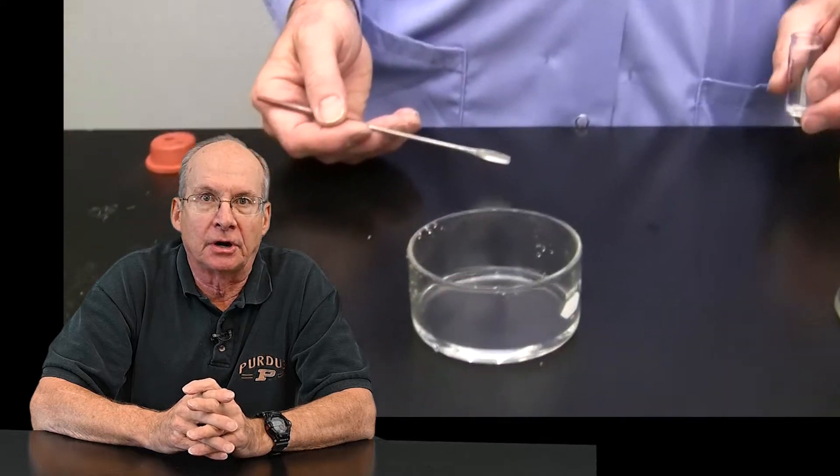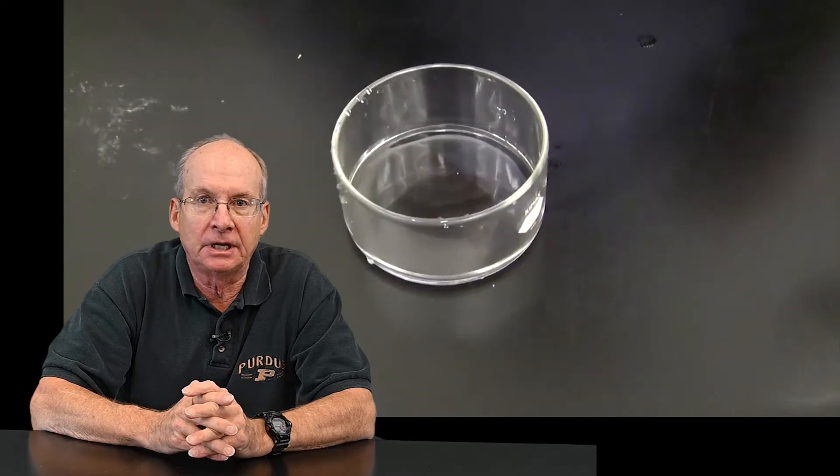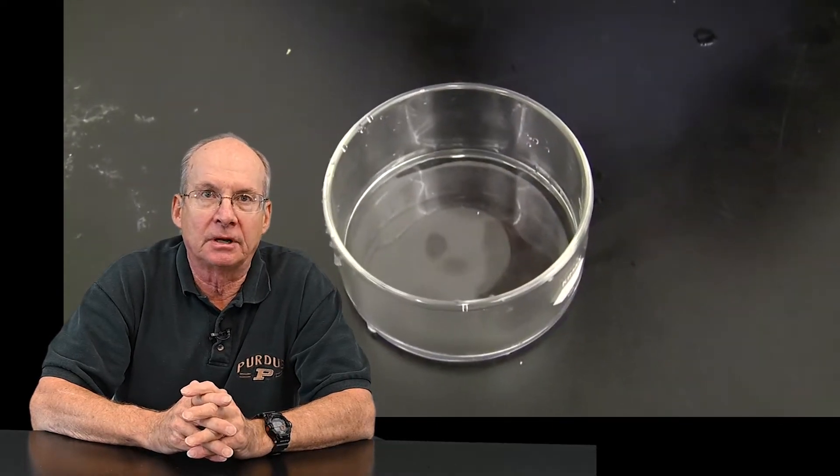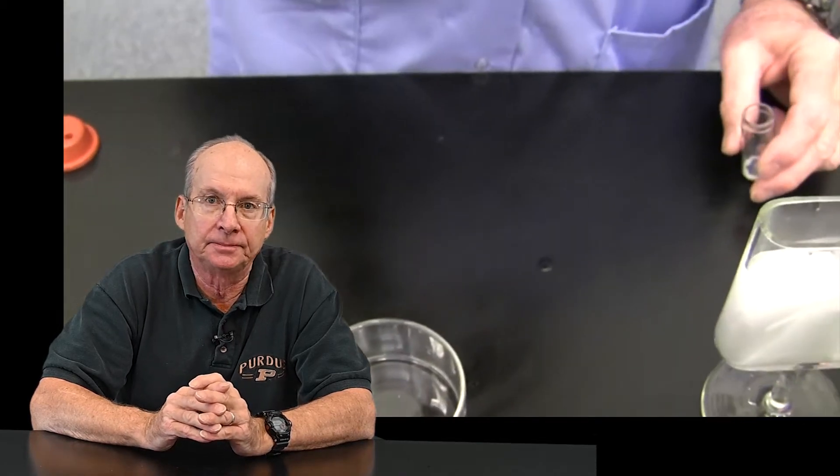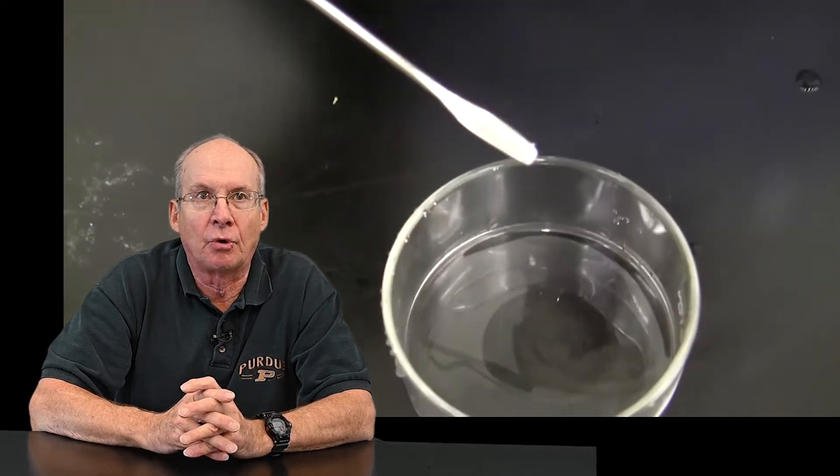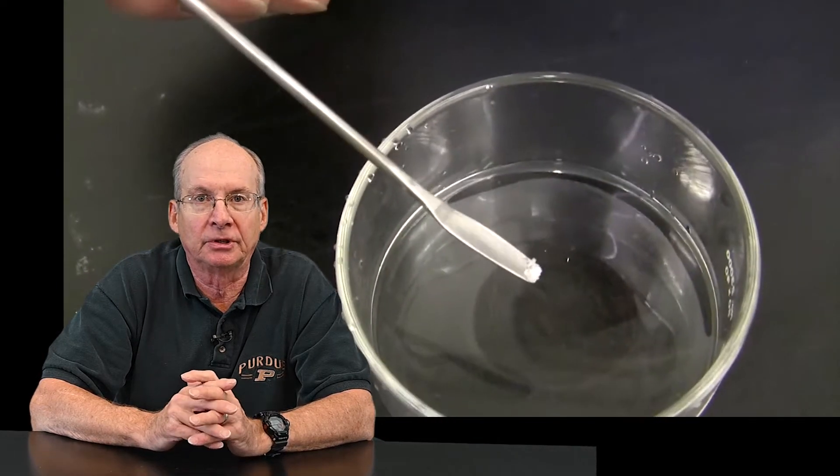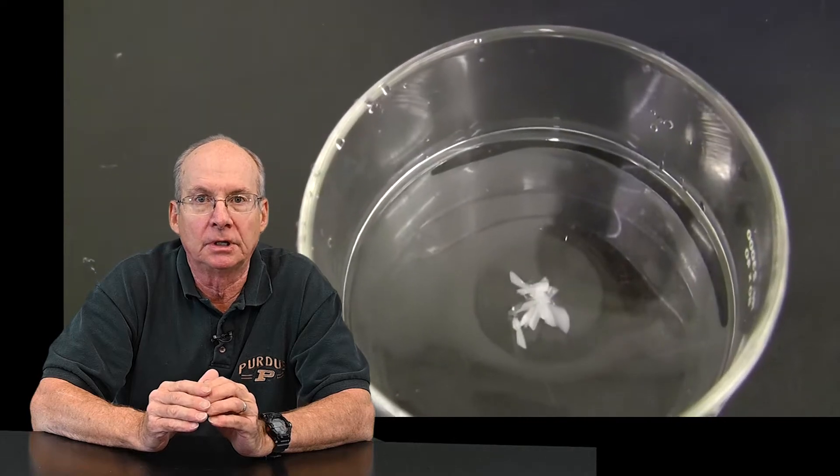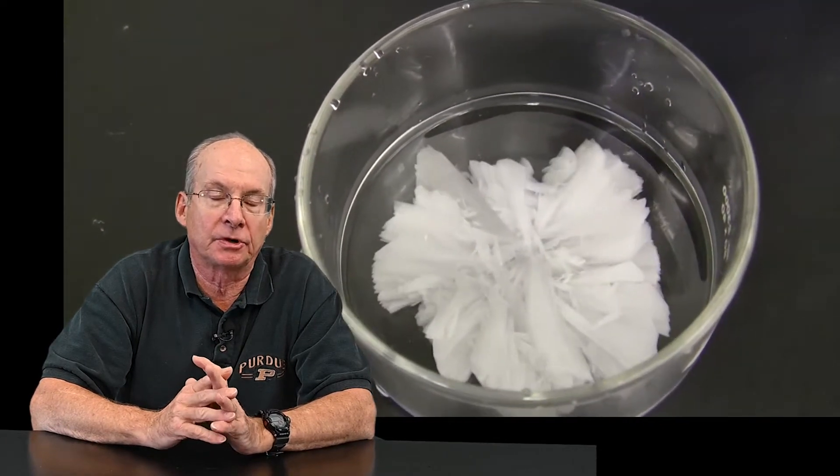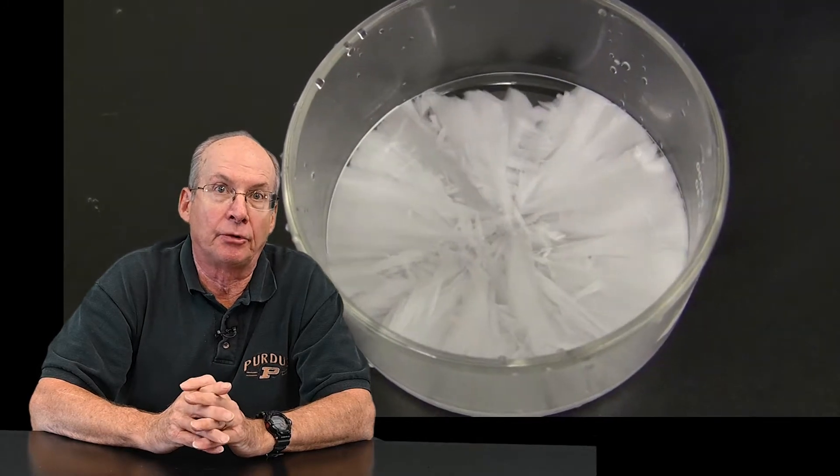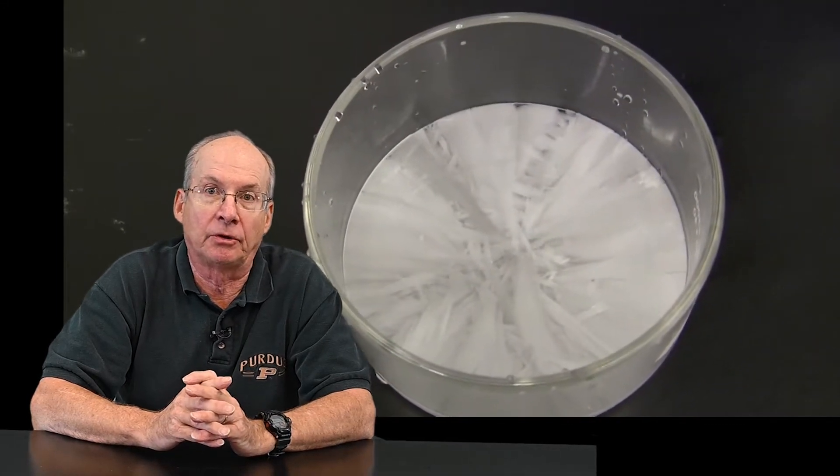The caution comes that it's going to go easily into liquid but because of its nature will tend to form a crust on the top, and so it requires continuous watching and attention. Otherwise you can build up pressure with the liquid getting warm below the crust sealing on the top, and there has been experiences or situations where the whole thing erupts and blasts the material out all over the place.